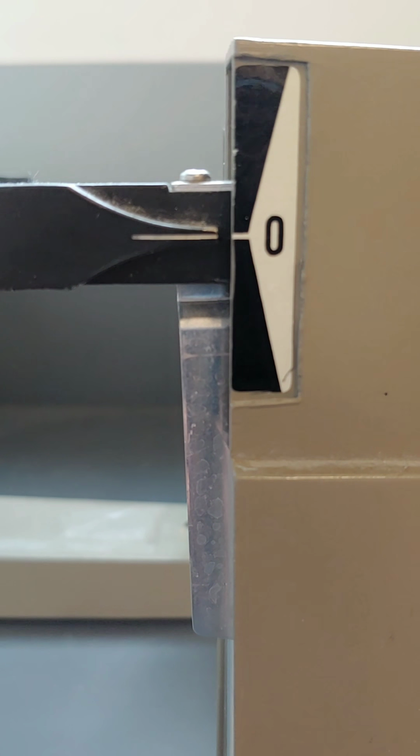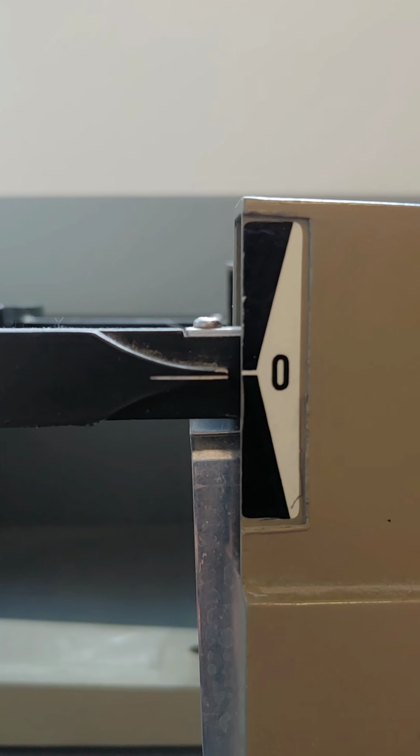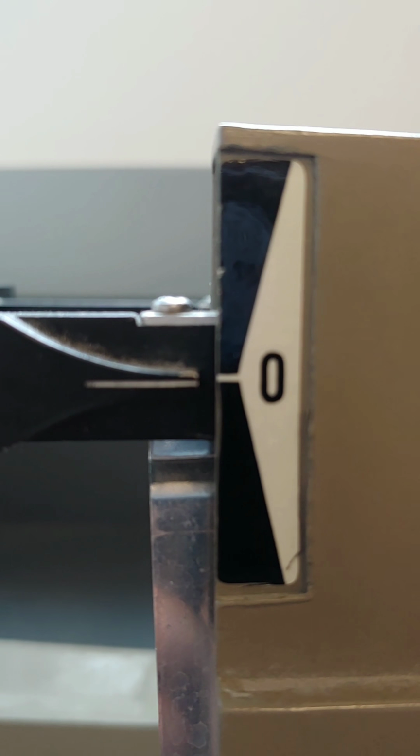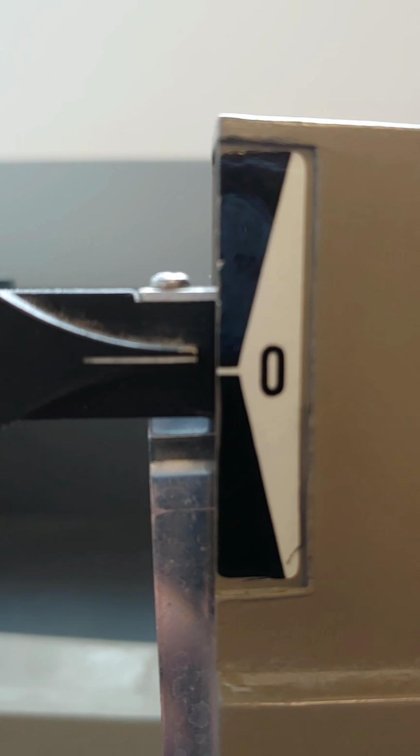And then when those two lines are even, that's when we've got our measurement. I don't know what you would say about that, but to me that looks like it's just a tad below the line. So I'm going to move this last little gram one back just about a hair, which is an exact scientific amount.